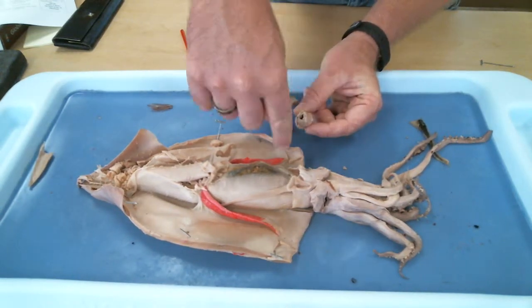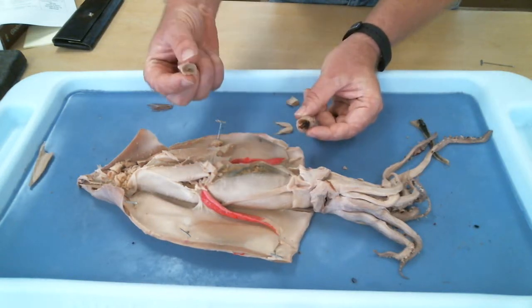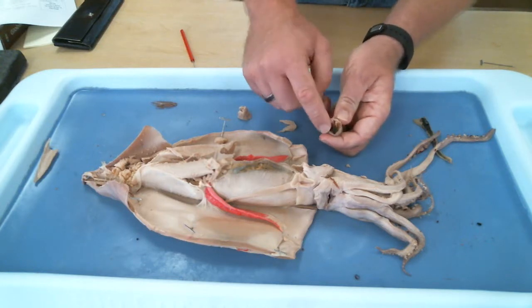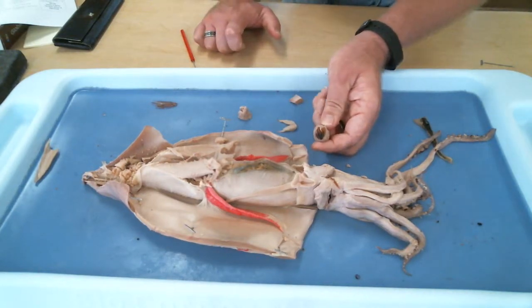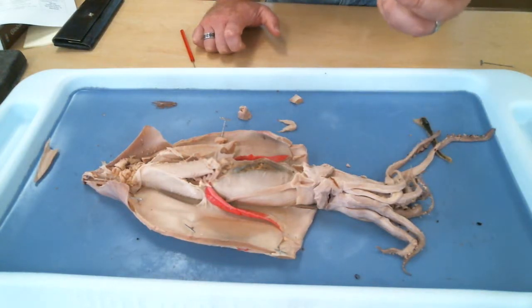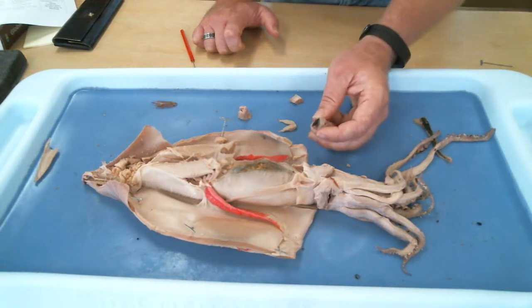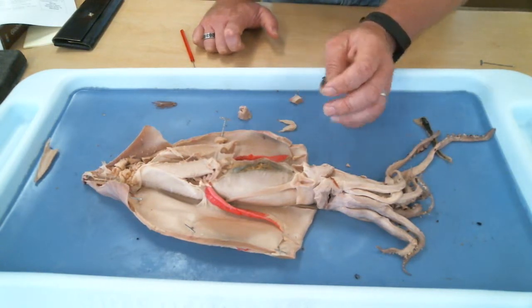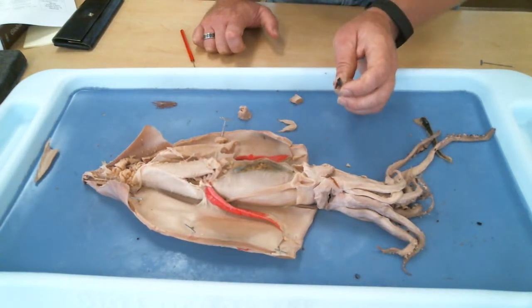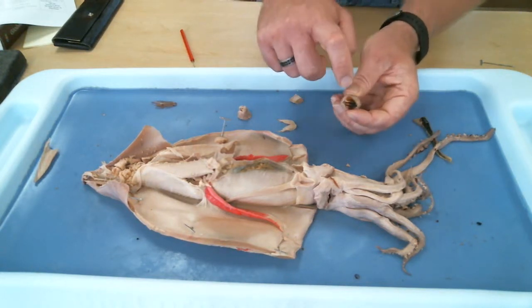When you cut the fleshy outer part, essentially his lips, when you cut those off, now you can see the hard structure back there, and that is the what? The beak. And this is the only part of the animal. That's not totally true. Never mind, I'm not going to say that. I was going to say this is the only part that is bilaterally symmetrical, but actually no, the whole animal is bilaterally symmetrical. So forget that I said that. So yeah, he has a beak, and this is the hardest part of the animal.